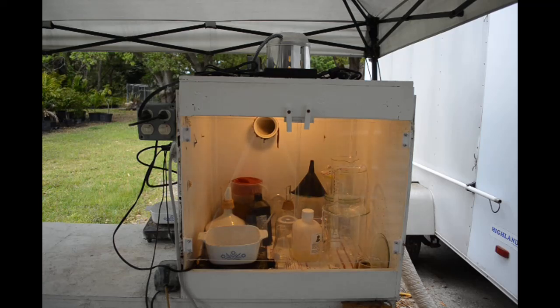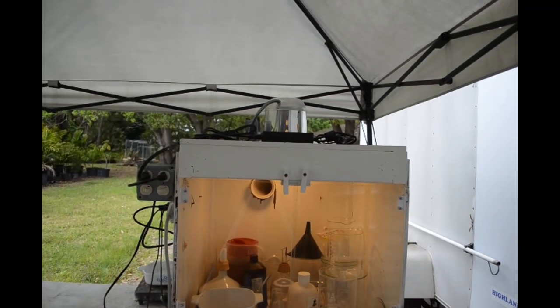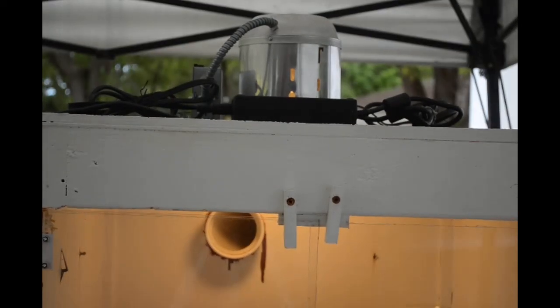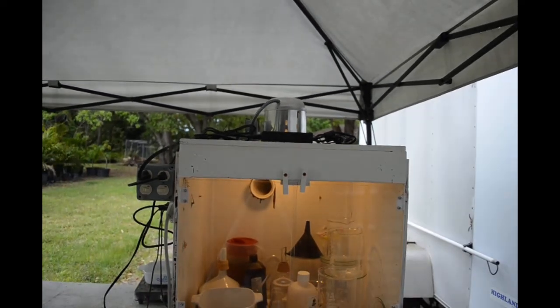So now I've got an in-ceiling can light up on top here above the ceiling with an LED bulb in it. I'll give you a close-up of the hole in the top of the fume hood that shines down through here in a little bit because there's a story behind why that hole's there.